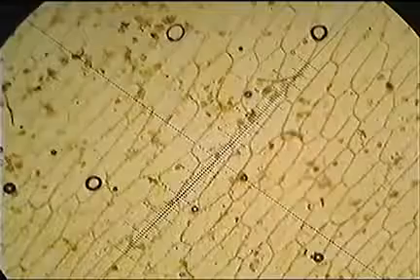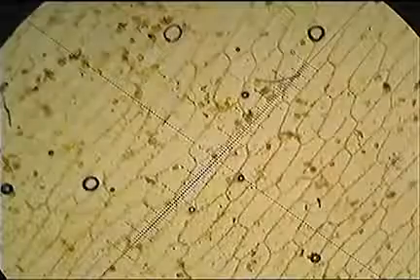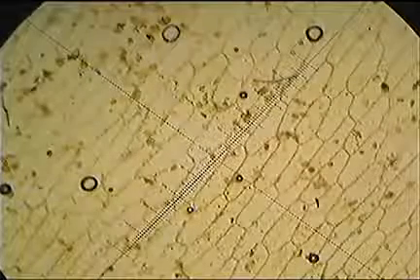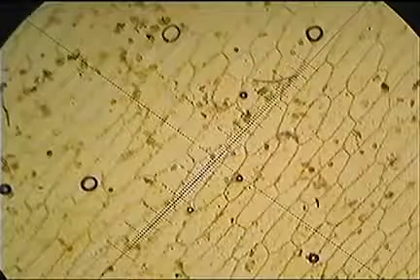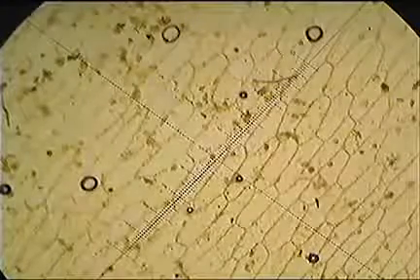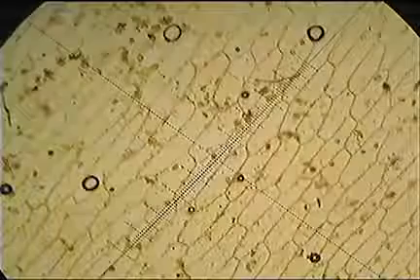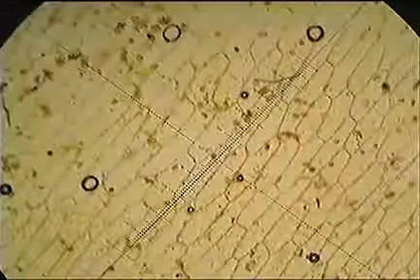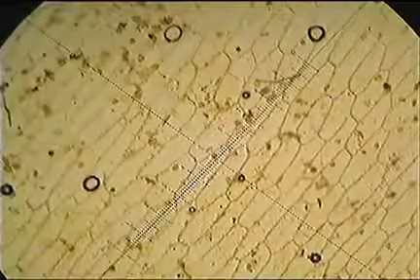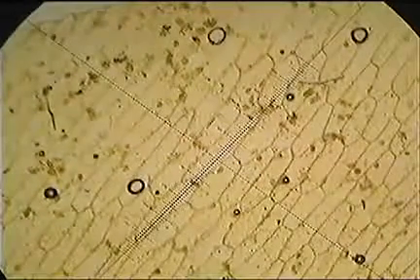So we're going to line up our cell. I've lined one up, looking at the cell just in the middle underneath the scale. You'll notice that rather than rotating the slide, it's much easier just to rotate the eyepiece, so I've rotated that scale so it's sitting diagonally. Lining up that cell in the middle, from the 3 to the 4, 5, 6, that's 3 eyepiece graticule units, exactly 3. So we would just take 3 times 0.099, which rounded is basically 0.30 millimeters across.